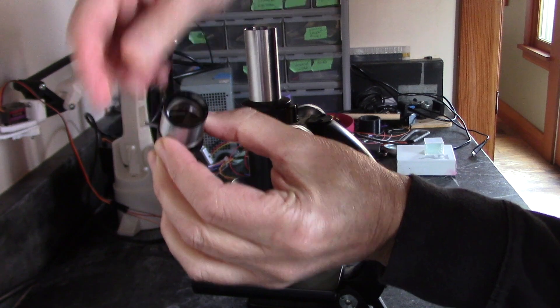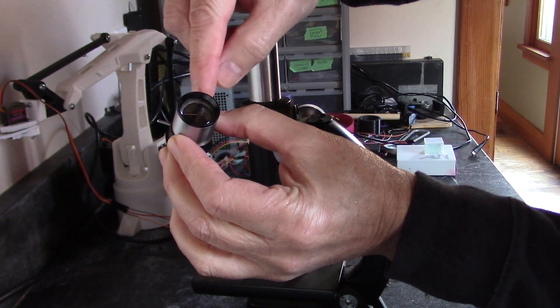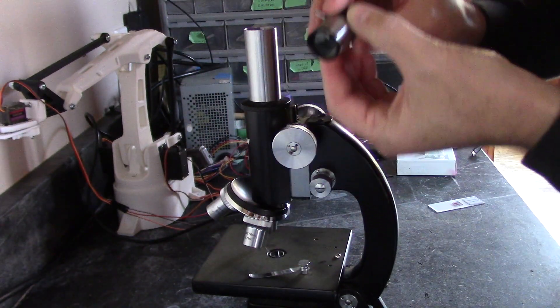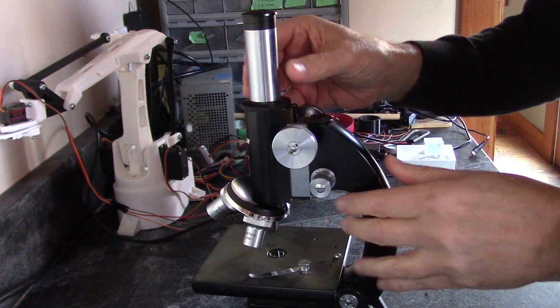So that if you have it on the bench here and you want to show somebody what you're looking at, then you can point right to it. Now I can't take a photo with that in action because I don't have an effective eyepiece projection way to photograph it.